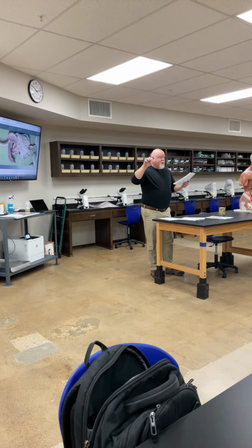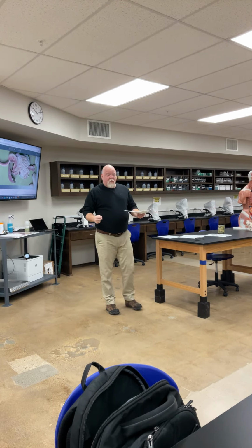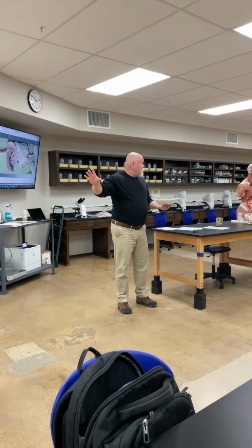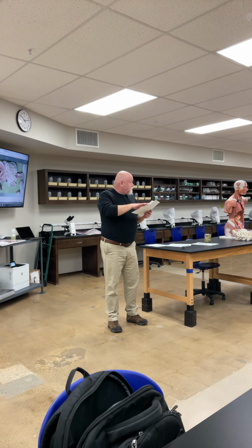The lamina propria, that's that connective tissue, and then the villi, because when we get to the duodenum, it's all about absorption now. Okay, small intestine's all about absorption. So we're going to see changes in the villi as we move through the small intestine. They look one way in the duodenum, and then in the jejunum slide, they look a bit different. Okay? Then we move into the large intestine, and there are a bunch of goblet cells in it that we'll look at.